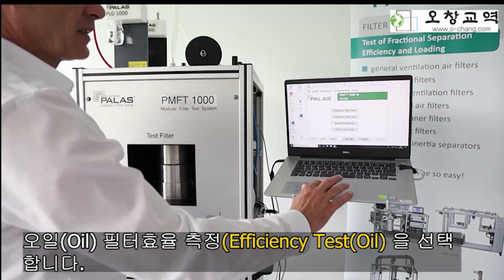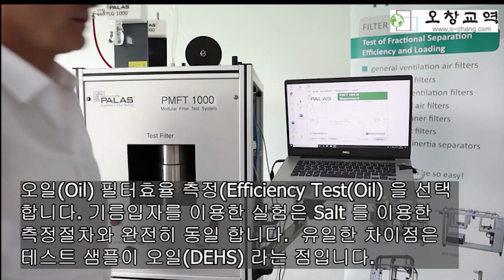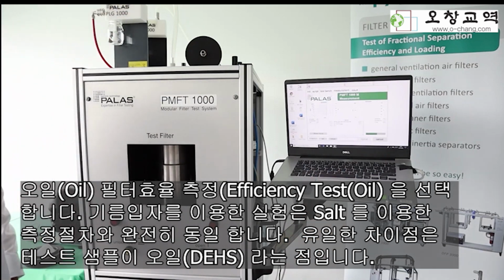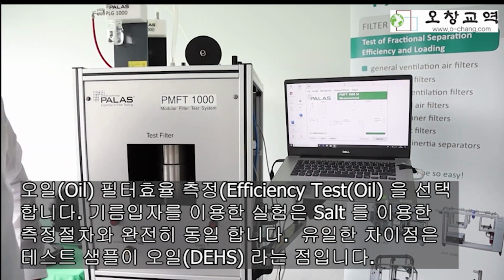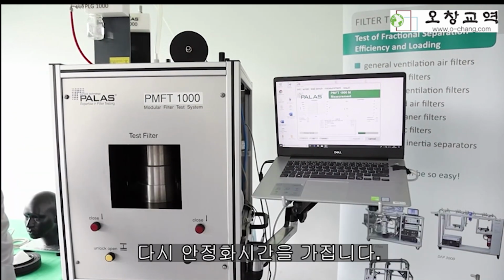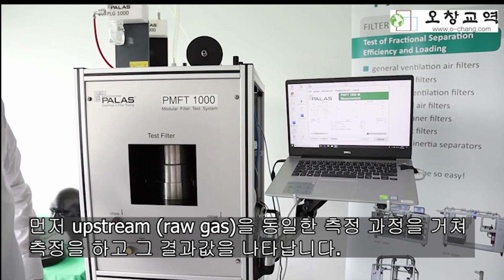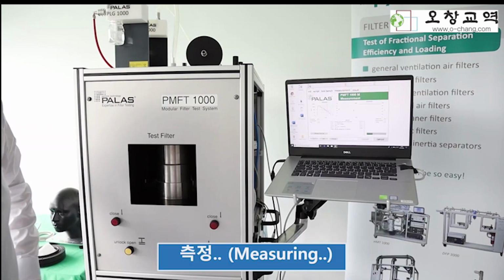The efficiency test with oil is completely the same as the efficiency test with salt. The only difference is that different test aerosol. So again, waiting for stabilization time. Afterwards, the measurement starts. You can see the distribution is built up, and you can see the photometer signal over time.